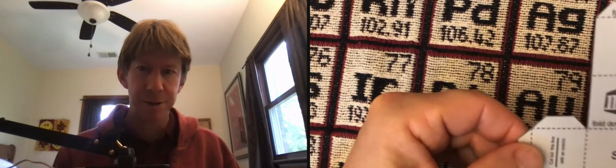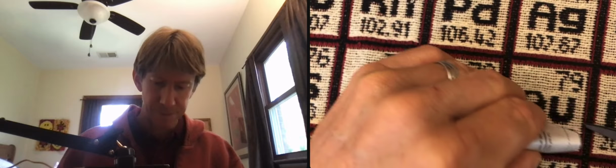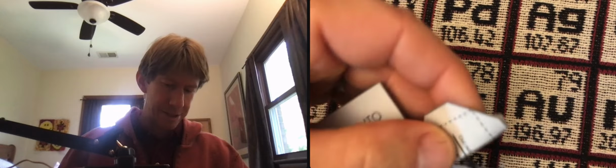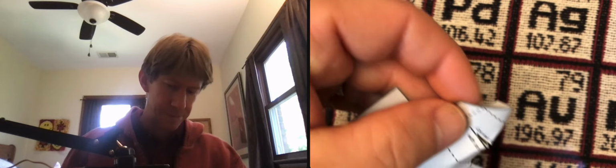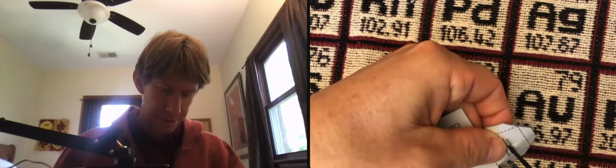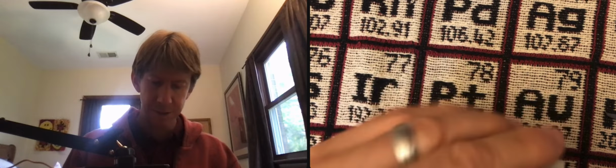Now the harder part, or a little harder anyway, is cutting out this line. I'm gonna turn it around so I can hold on to it here. And I'm gonna fold it, and I'm gonna cut the line. Actually, I'm gonna fold this all the way. I'm gonna cut the line as best I can. I start it a little off, but then I'm gonna go ahead and cut it. Let's see how we're gonna do this. I'll tell you how we're gonna do this. We're just making this up on the spot.